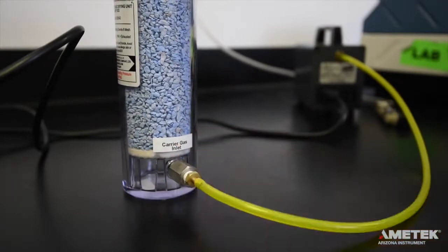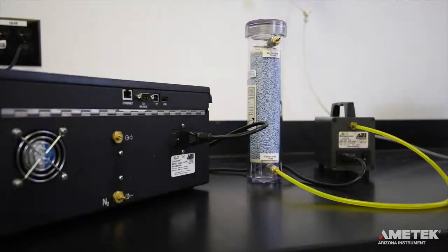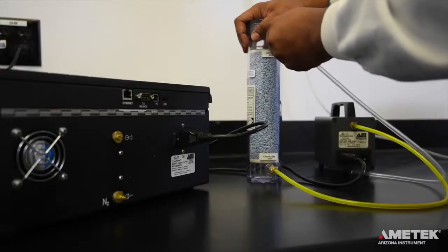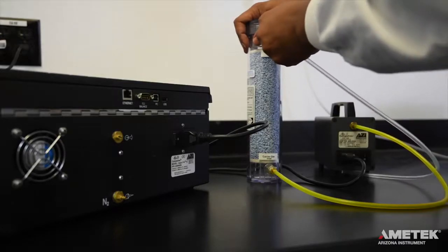If the yellow tubing is accidentally used to connect the desiccator to the instrument, ambient moisture could permeate the tubing, enter the flow system of the instrument, and cause erroneously high moisture readings.